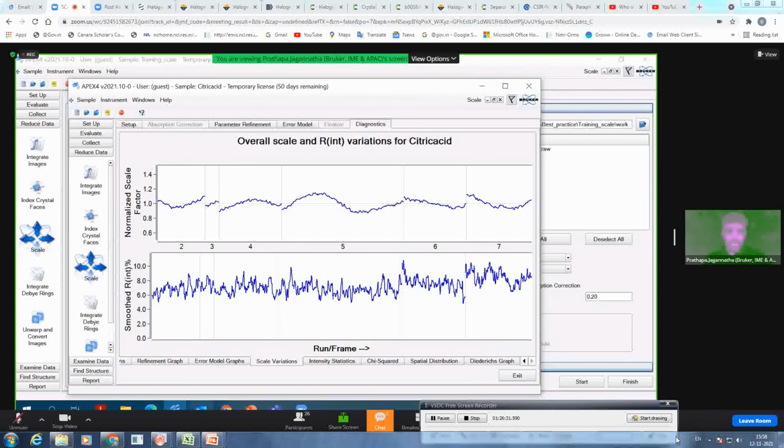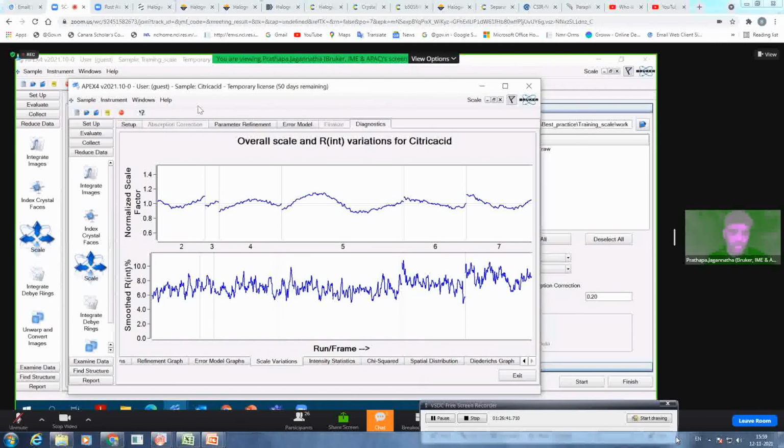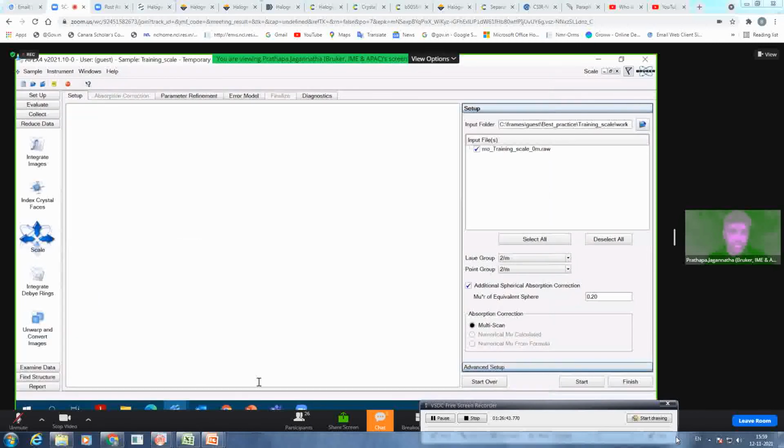Okay, so I just wanted to show you that this is good data, so you do not have any issues. Now I want to take you through another data set. Where is this? Probably this is the one. No, this one. Yeah, I think this is the other data. Again, this is customer data which I cannot show you, so I have integrated it and it is ready for scaling. So I just start the scaling.